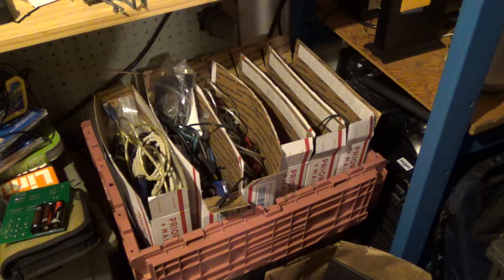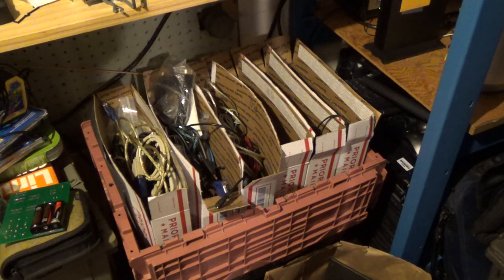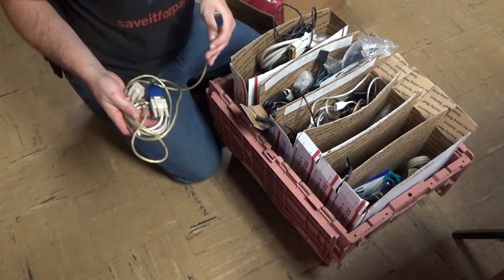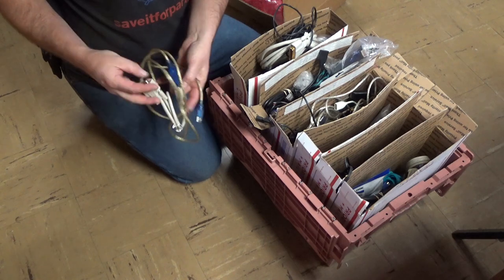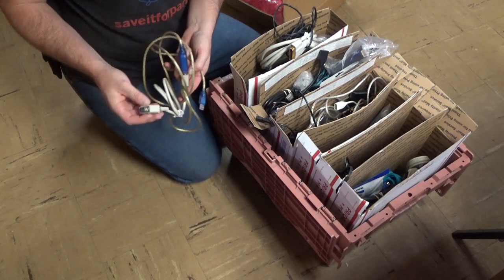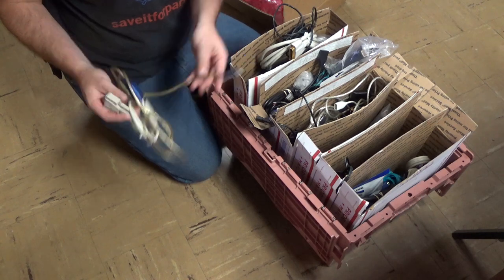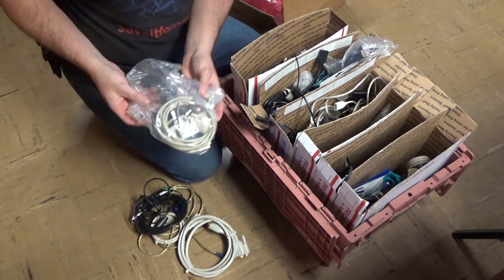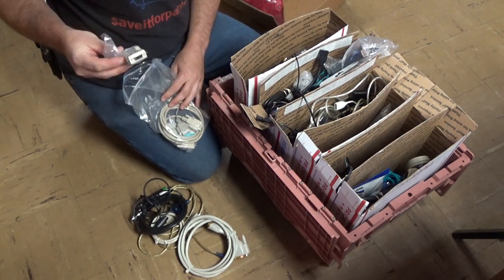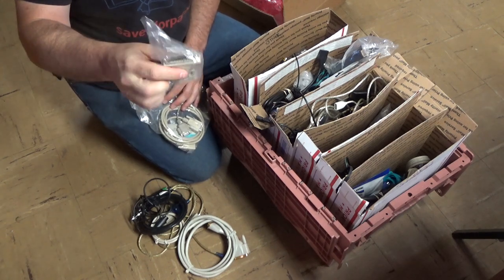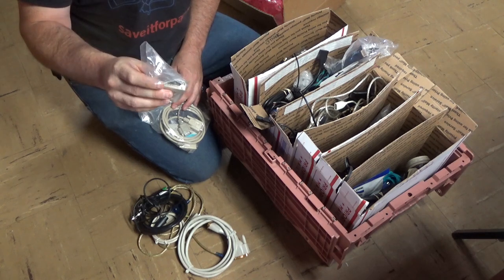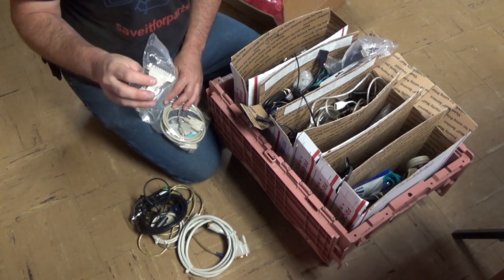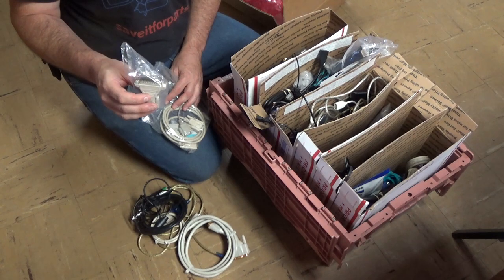Now, I hate to just give up on this thing right now, and I do have about every cable ever made in this box of junk hoarded away, so let's see if we can talk to it. Well, I do have a USB to serial cable. Unfortunately, it's just the regular 9-pin serial. It's not that 25-pin printer cord from 1976. Ah, here we go. See, I knew if I dug around in my garbage long enough, I would find an adapter to go from 9-pin to 25-pin, because, hey, you never know when you're gonna run into some old tech that needs something ridiculous like this.